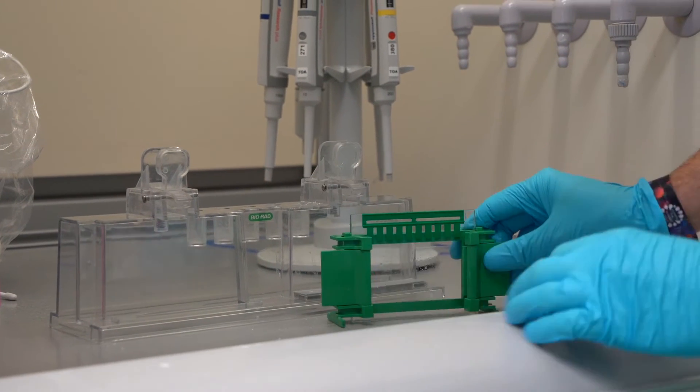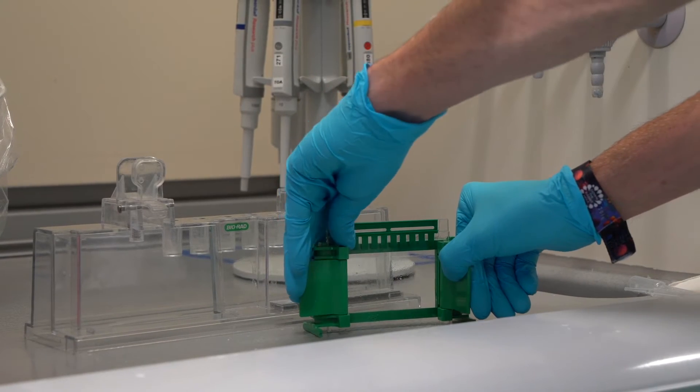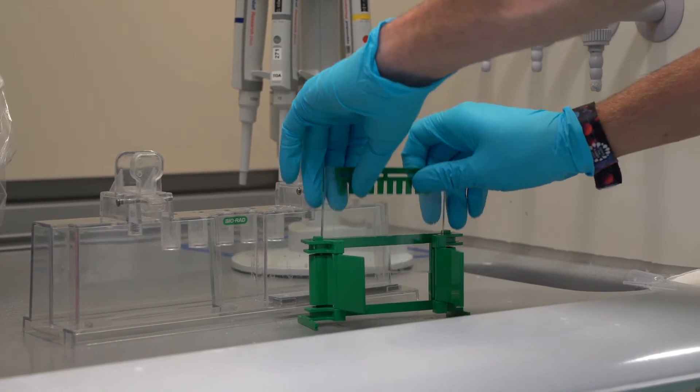When the gel is fully polymerized, the casting frame can be removed from the casting stand. Then loosen the clamps and carefully remove the glass with your gel from the casting frame.